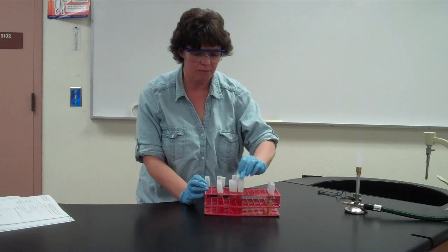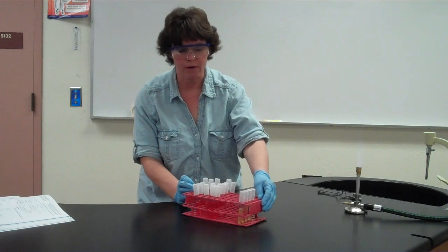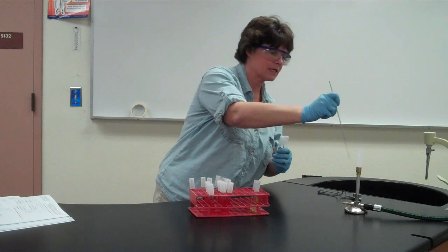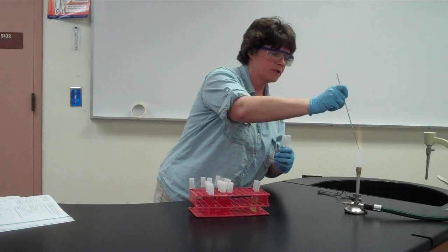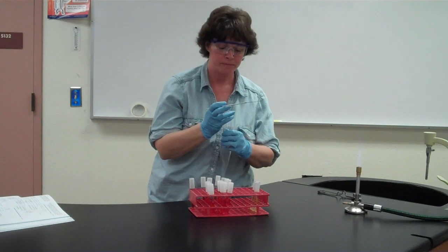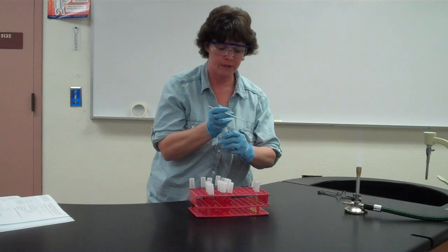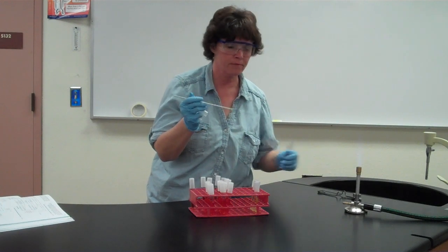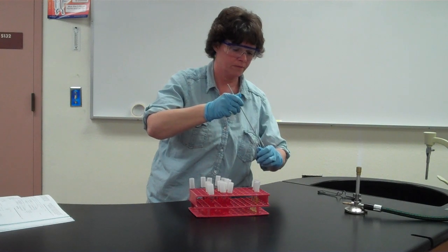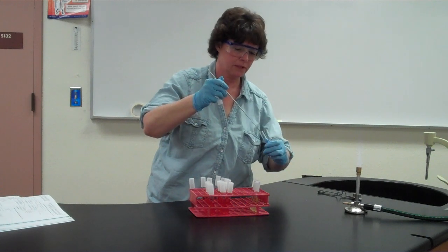So I'm going to take this bacteria and put it into these 3 tubes. I'm going to take the second bacteria and put it into these 3 tubes, and so on and so on. Well, I'm not going to do all of them, I'm just going to show you one. Okay, so as always, we're going to use our same aseptic technique of flaming our loop first. Okay, as that's cooling, going to go ahead and take off our other 2 tubes, our lids. I'm going to flame those. Oop, didn't let it cool off long enough there. Okay. And then we go into the tube.